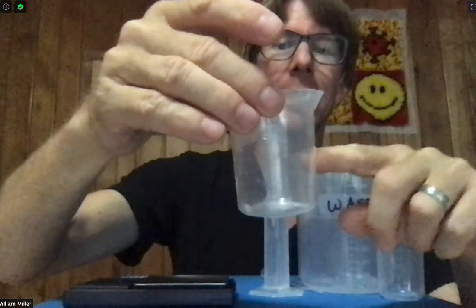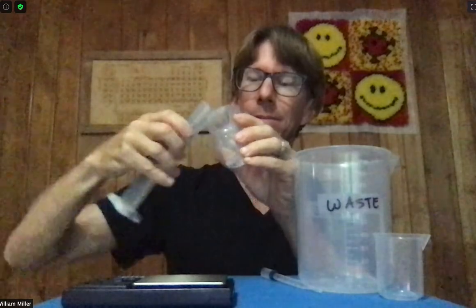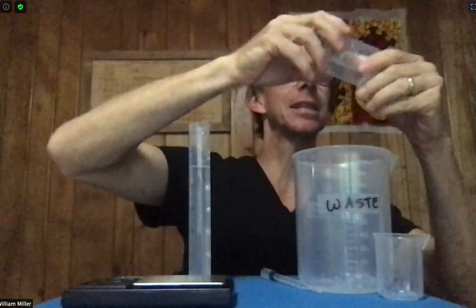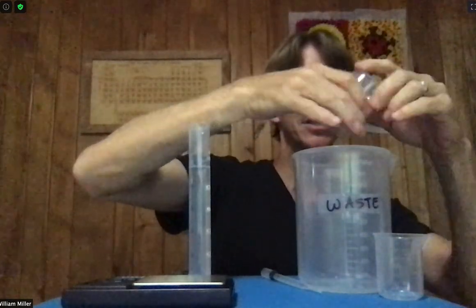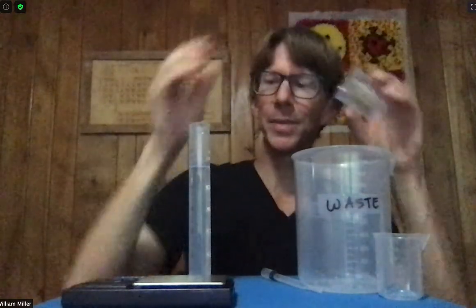I think it's distilled water. So what I'm going to do is take a very small amount and coat the insides. One way to do a good job of coating the insides is to tilt it and pour it out into my waste beaker.